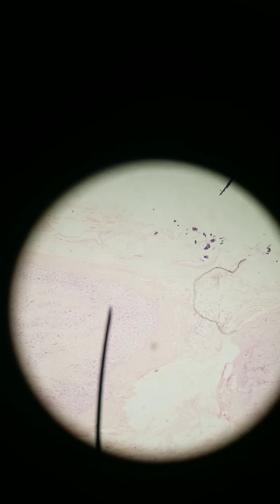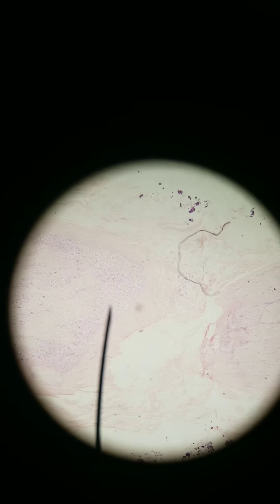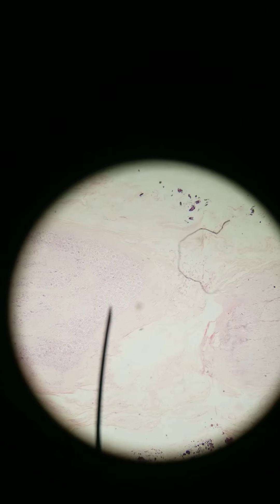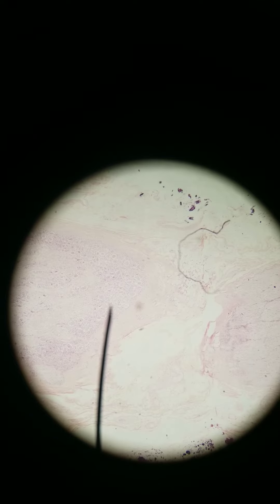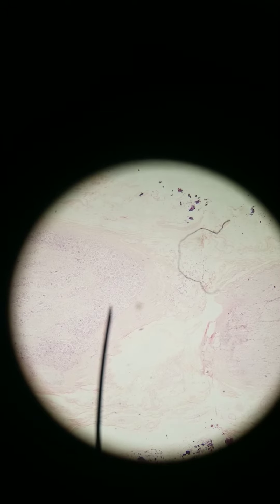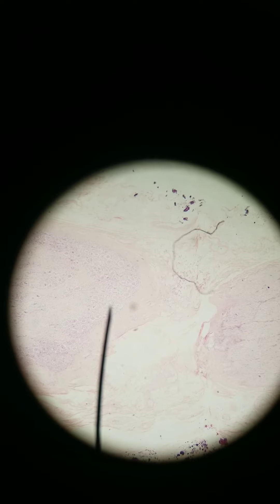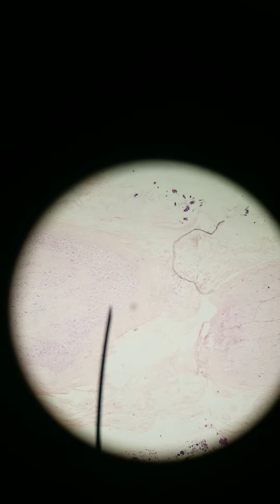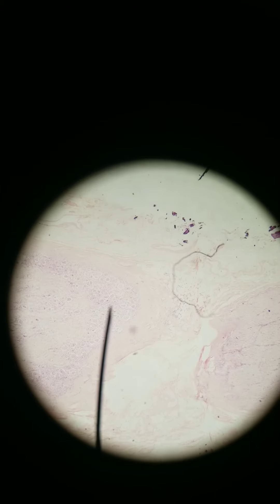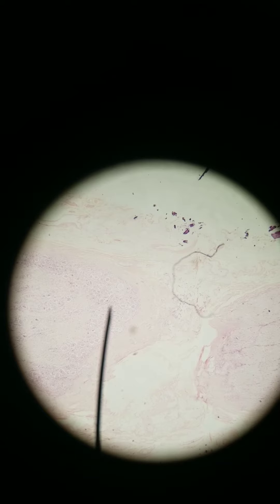These are sensory neurons, and their shape is pseudounipolar. That means the cell body is off to the side while axons are running in a different way. But they're still connected, because axons have to be connected to the cell body — they're just kind of separate from each other.